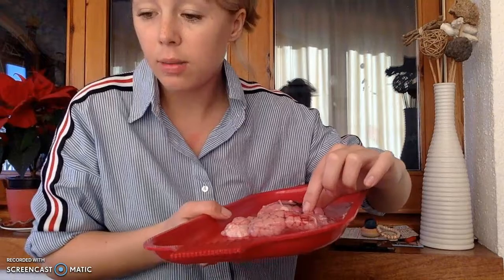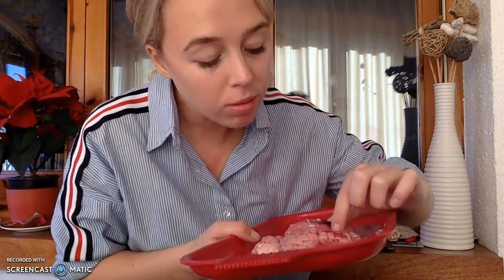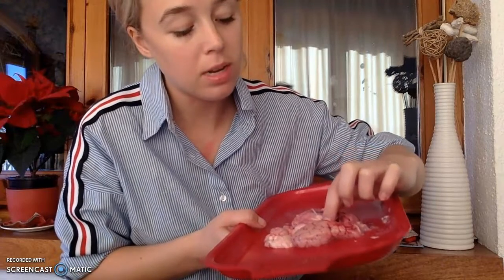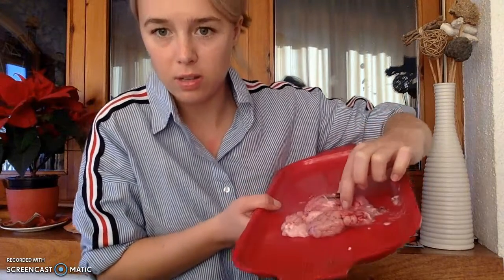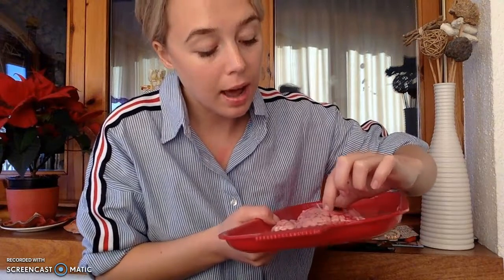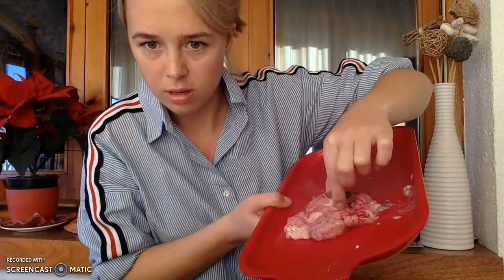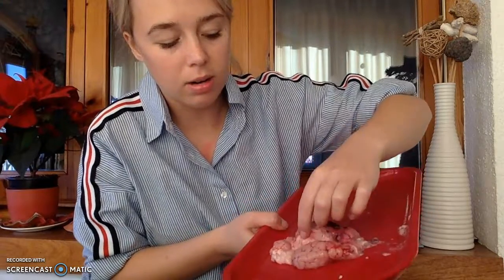So the first thing that we have, looking at my list notes so I don't forget anything, right through here is where we have the thalamus. Okay, and then right beneath, right here where my finger is, hard to see, that's a hypothalamus. And then moving back, we have the midbrain, which is this structure. White structure right here. I know it's hard to see.